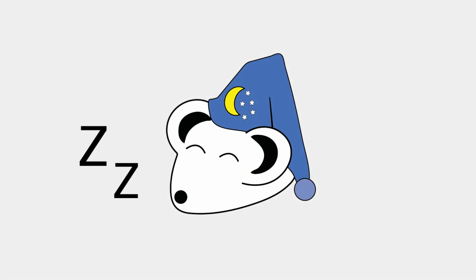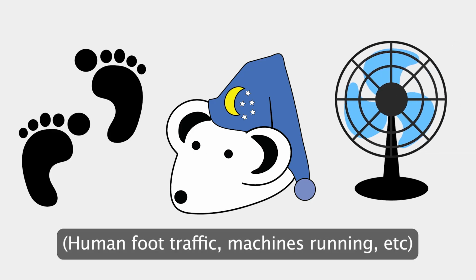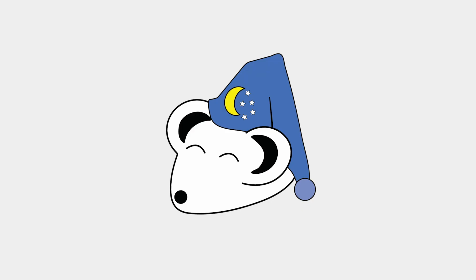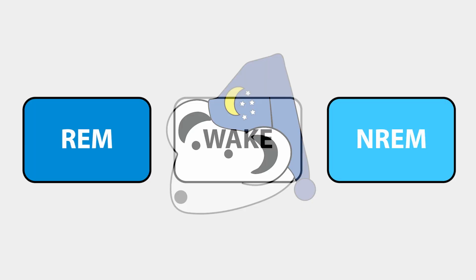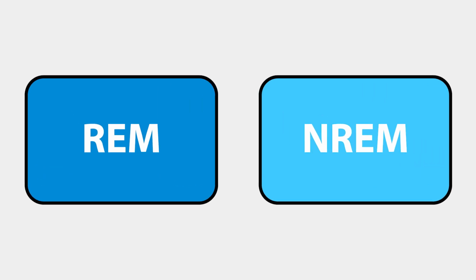When assessing signal quality, it is best to find time intervals where the mouse activity is the lowest and building/lab activity is the highest. The most difficult separation for the sleep-wake classification is discriminating between sleep and low-level activity or rest. For the three-vigilance state algorithm, separating REM from NREM sleep is the most difficult. Both of these rely on extracting signal parameters related to subtle changes in respiration.